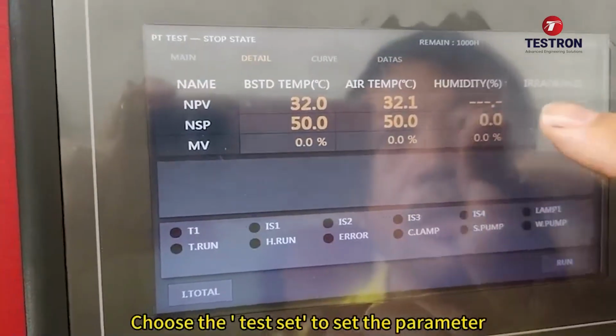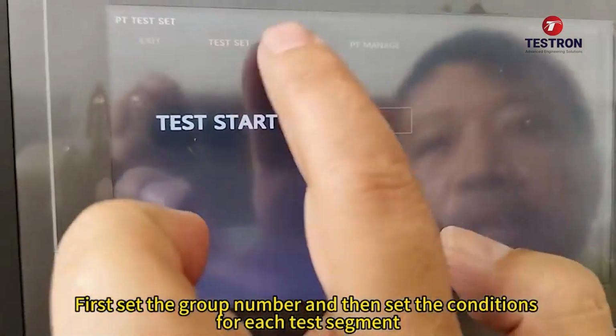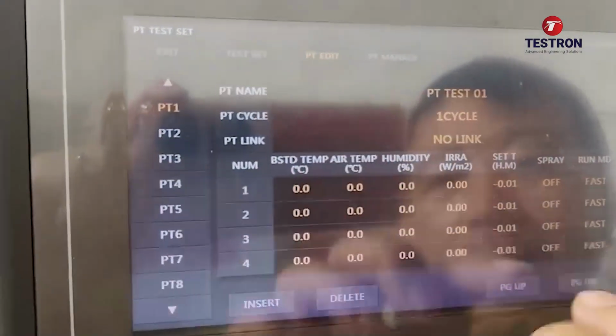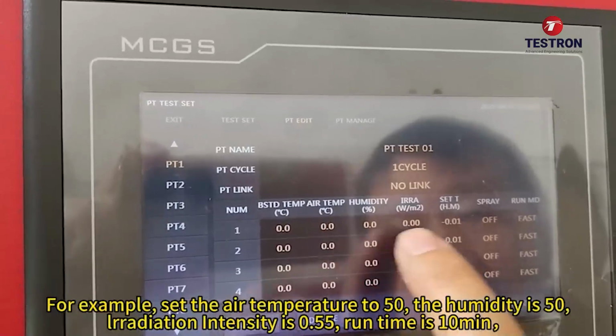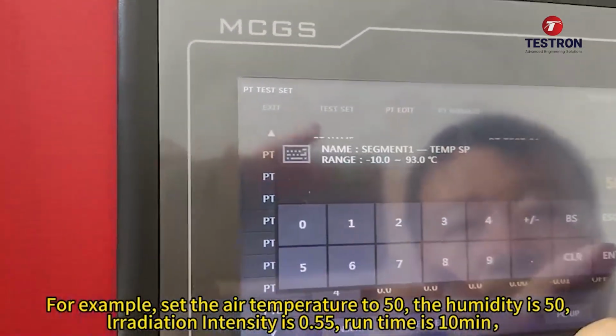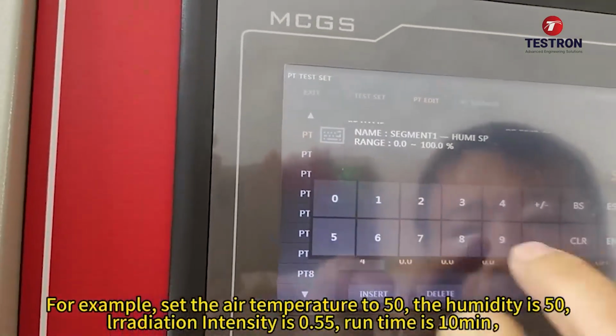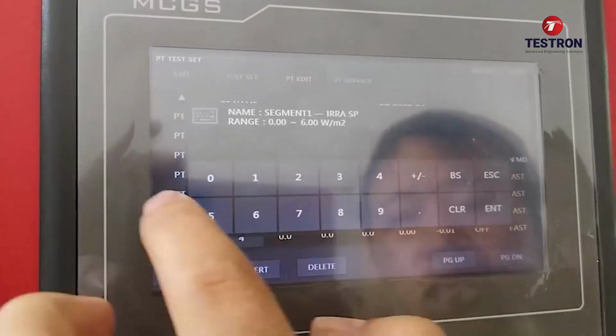Choose the test set to set the parameters. First set the group number and then set the conditions for each test segment. For example, set the air temperature to 50, the humidity to 50, radiation intensity to 0.55, and running time to 10 minutes.